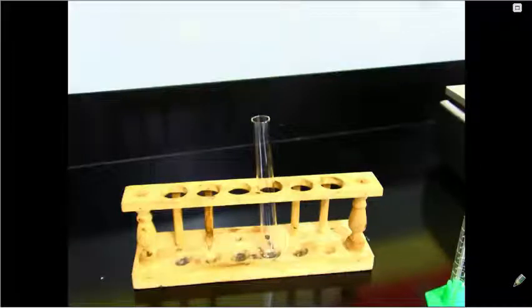In this investigation, we are measuring the effects of changes in temperature and enzyme concentration on reaction rates of an enzyme-catalyzed reaction. So this will be a controlled experiment where we're going to try to explain how environmental factors affect the rate of enzyme-catalyzed reactions.